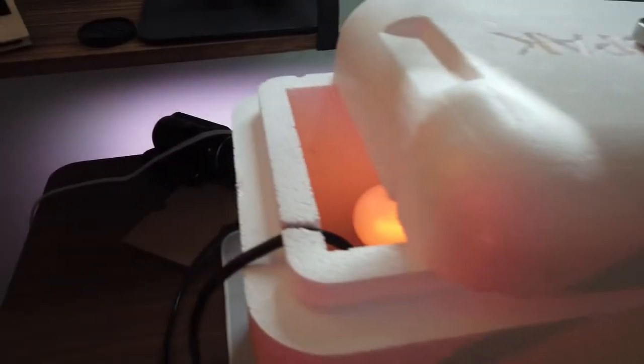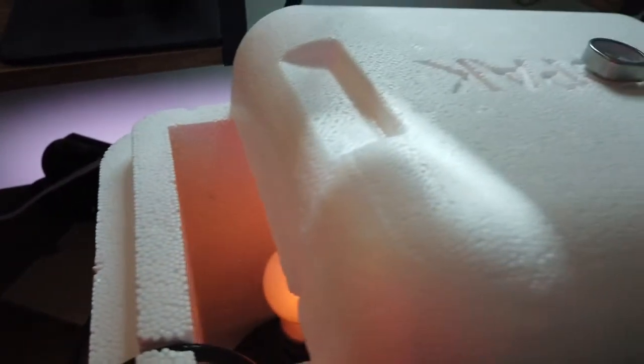All right, so I've finally been able to get it to stabilize at around 96 degrees. That's about where I would like to see this set. Had to finagle this a little bit. Actually, I have to leave this cracked open. I've got the bulb barely lit and got the top cracked. And if you can see it, I don't know if you can see the measurement there, but it's about 96 degrees. So this is where it's going to need to be.